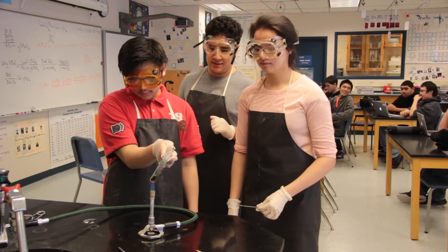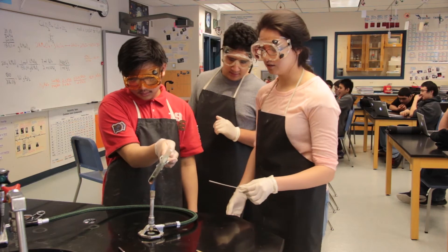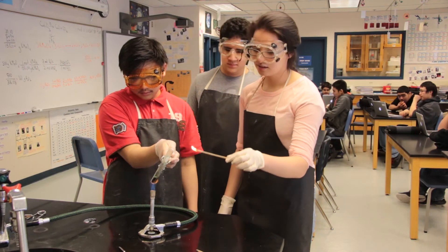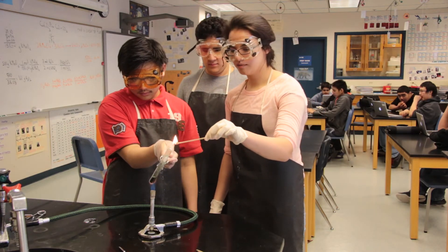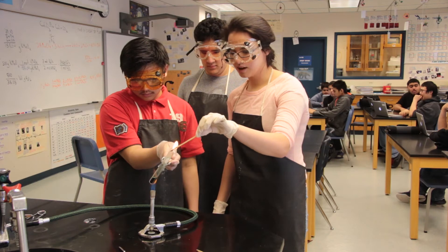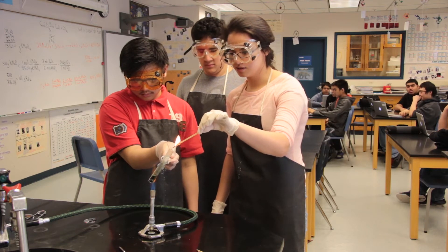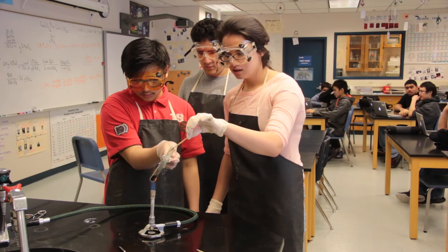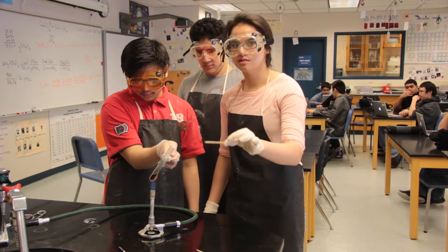And Ana will demonstrate the carbon dioxide that is being released. Yeah, so we're going to show that it's being released by putting a flame slightly to the test tube. The flame goes away as you can see when you enter it in, which shows that there is carbon dioxide in there instead of oxygen. And there, now it clearly extinguishes.